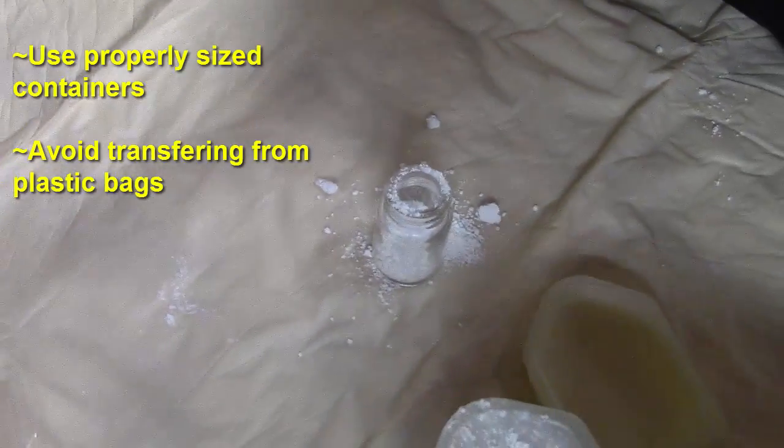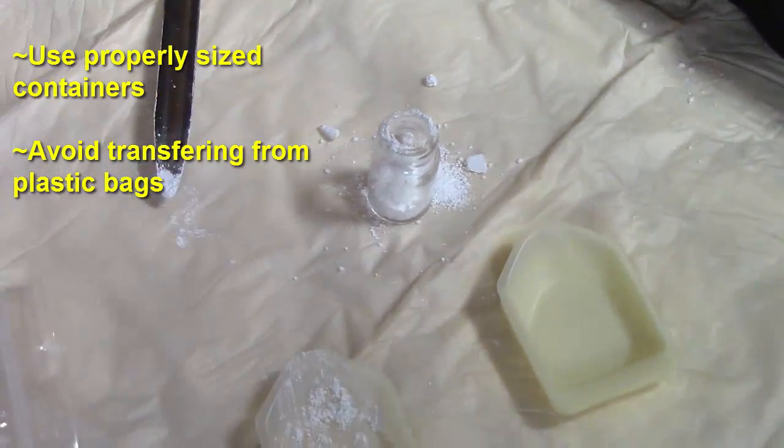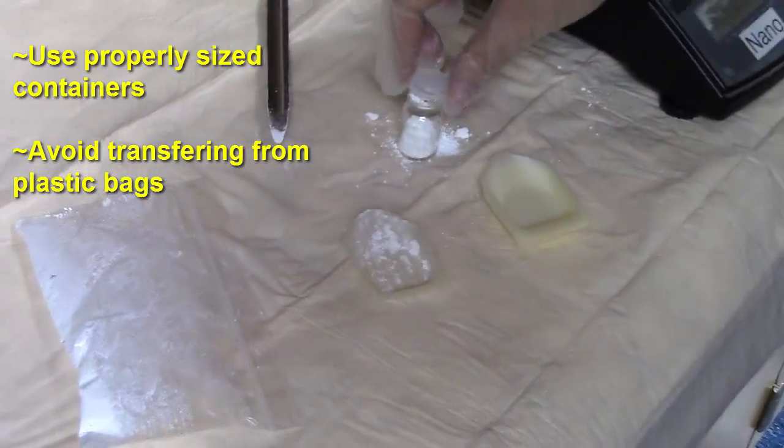When working with powders, be sure to use properly sized containers. Also, avoid plastic bags which can generate static and make transferring a powder difficult.